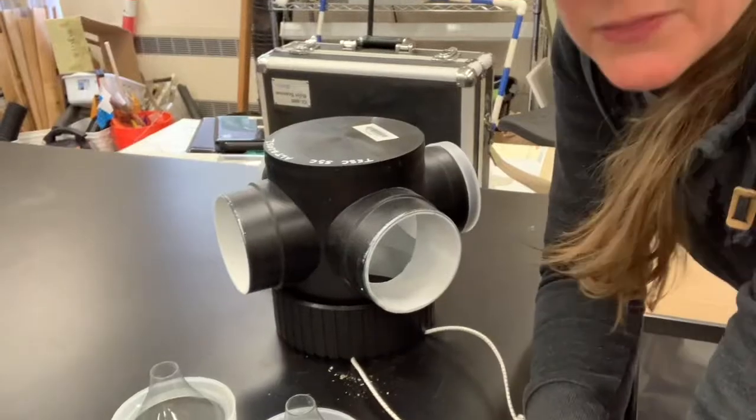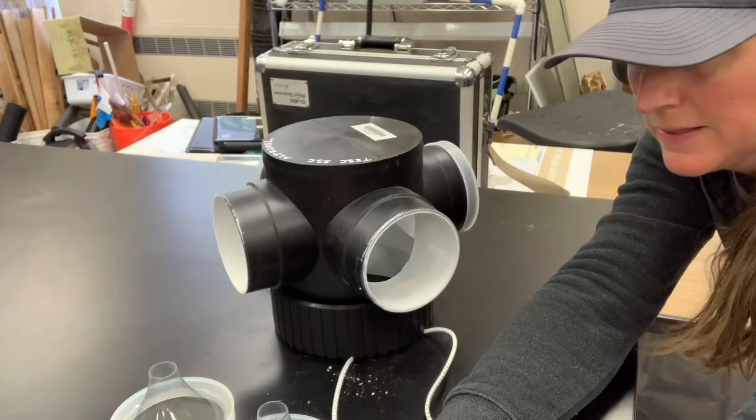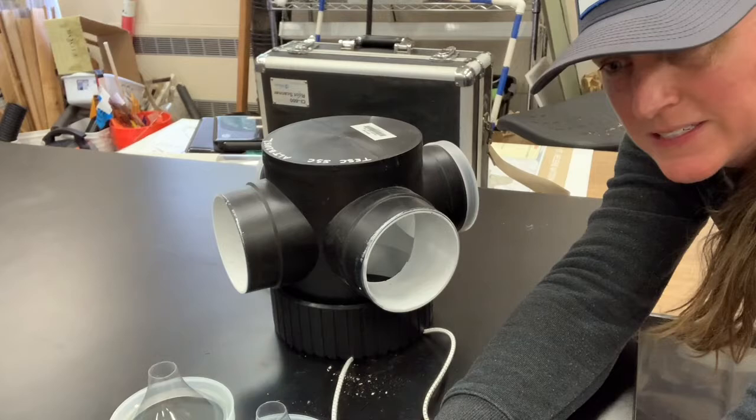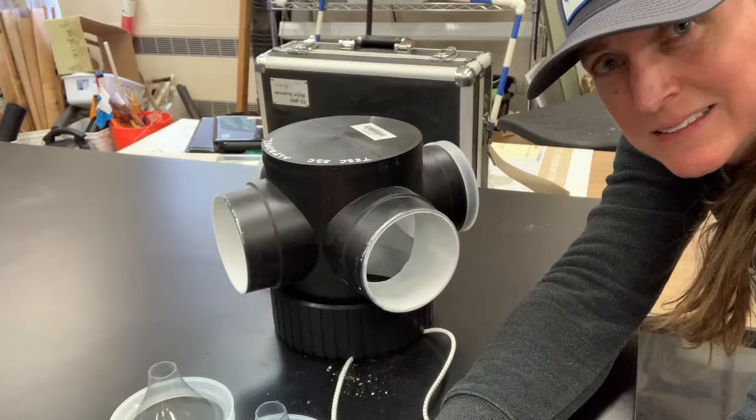There are various types of light traps for catching insects. This one that we have available at Evergreen uses your standard light sticks that you crack and then they start to shine.